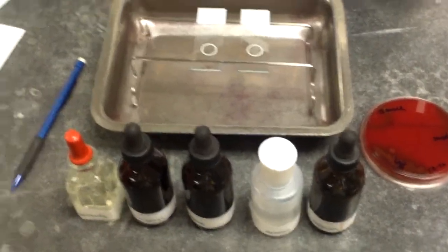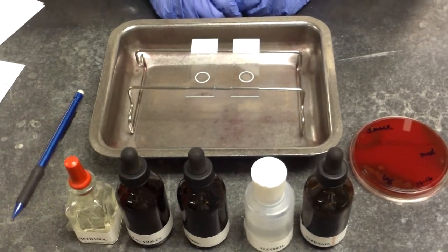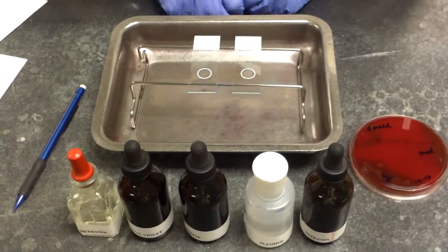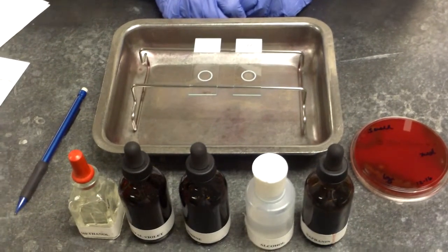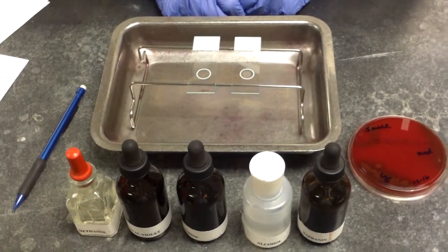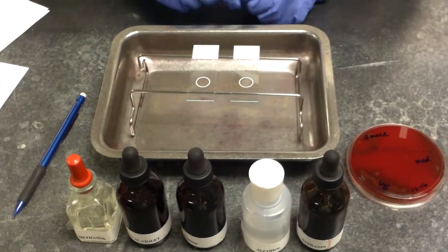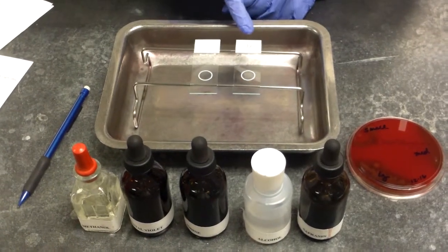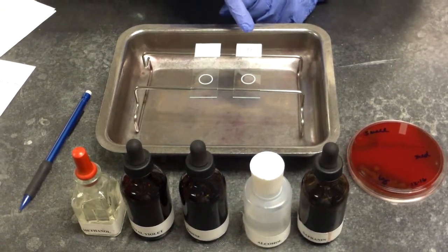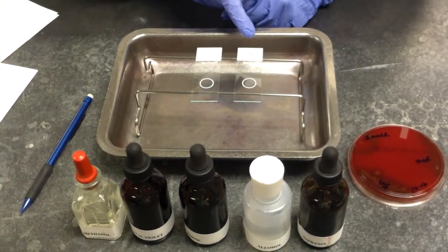We are going to demonstrate the gram stain technique. We utilize a gram stain in the microbiology lab to help with microscopic identification of bacterial organisms. The materials needed are a sterile slide, a QC slide which is incorporated with a gram-positive and a gram-negative organism.